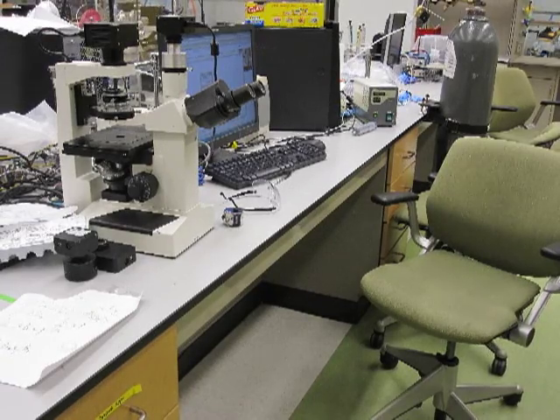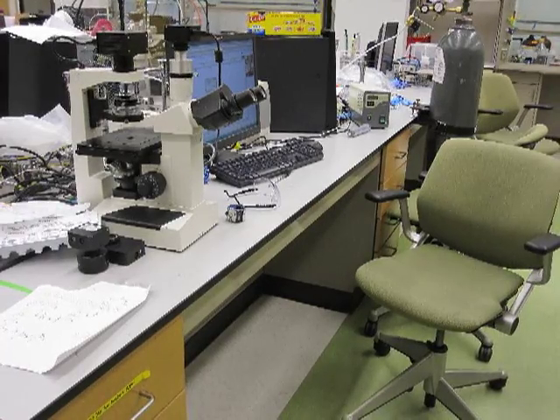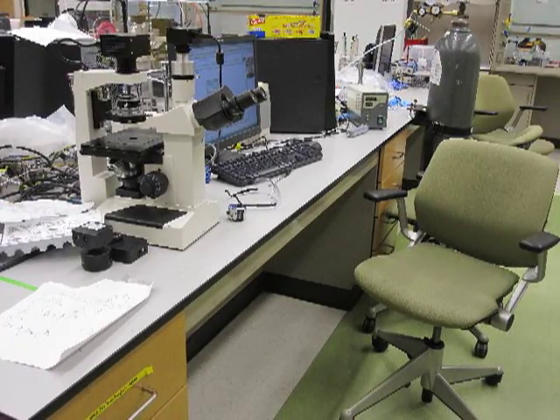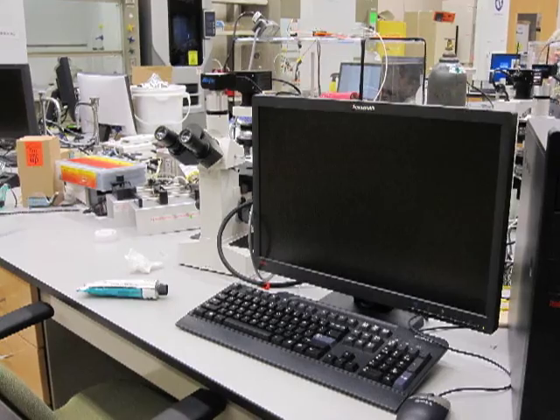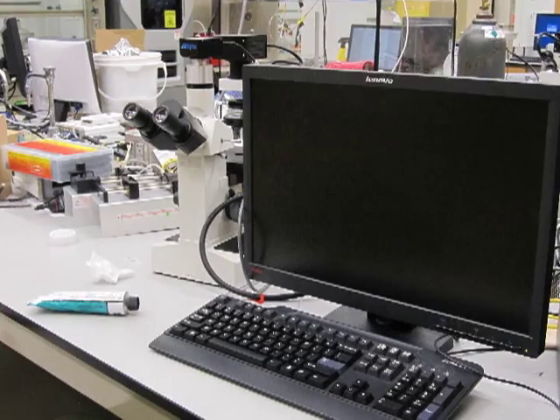Here in the biomedical engineering laboratory, you can find an XDS 1 inverted microscope at each station with a working computer. Locate one of the microscopes in the laboratory and follow these instructions to set the microscope in bright field.